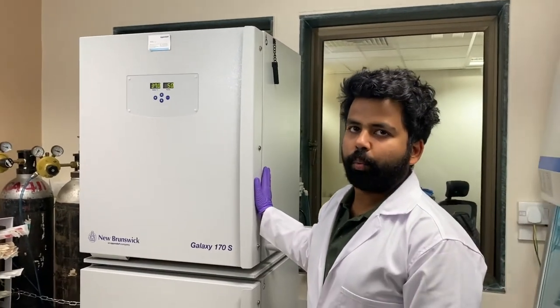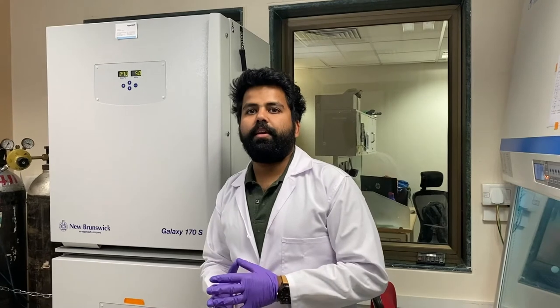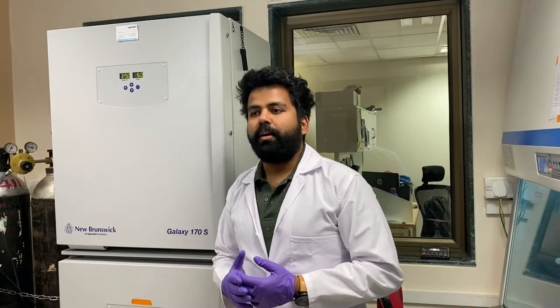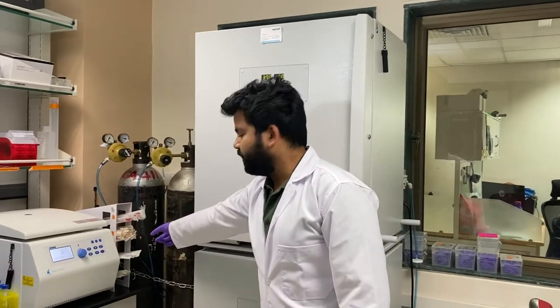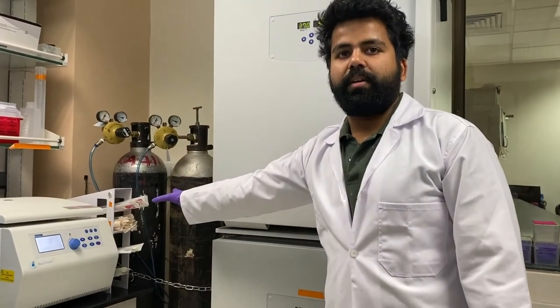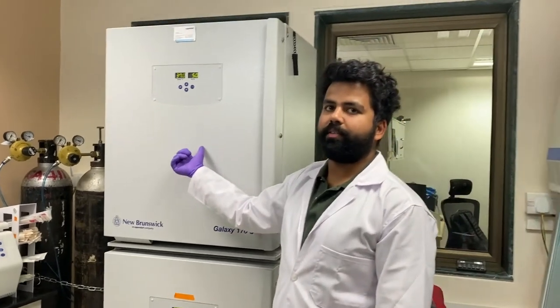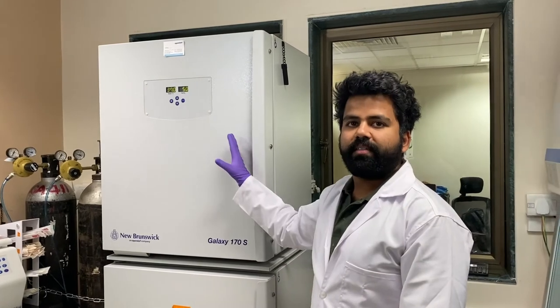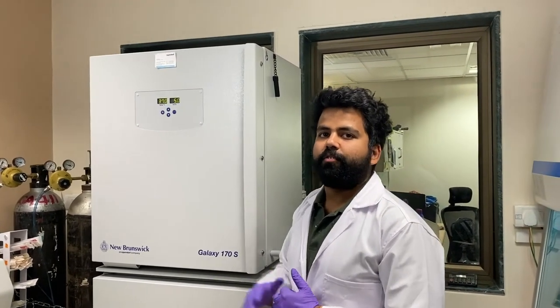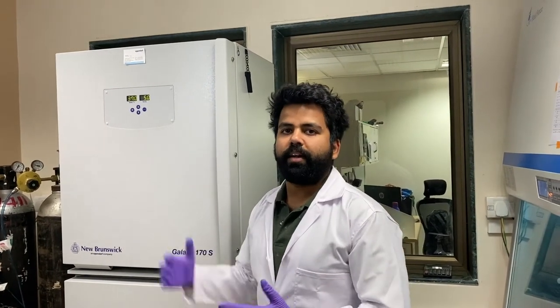Cells additionally require a certain CO2 concentration — the level present in air is not sufficient for them to grow. These machines are attached to carbon dioxide cylinders, and through blue pipes they pump CO2 into the incubators, maintaining a level of about five percent air pressure. Temperature and CO2 are the two most important conditions for cell growth.